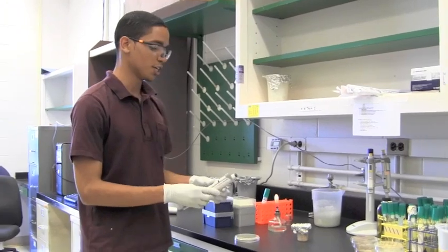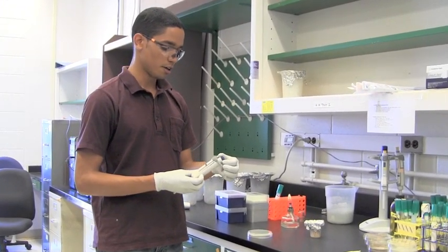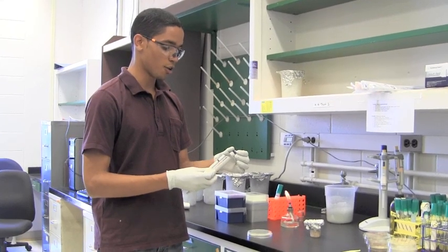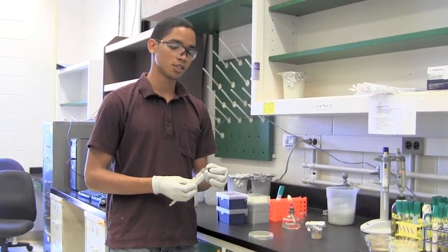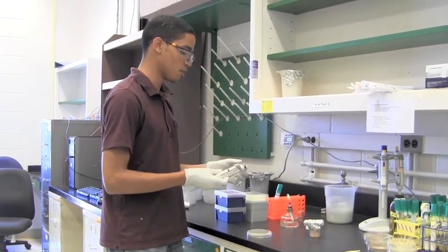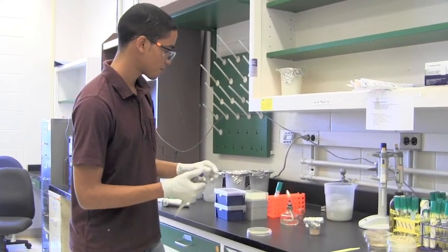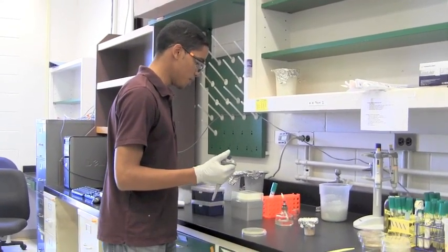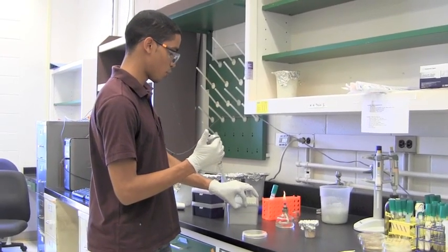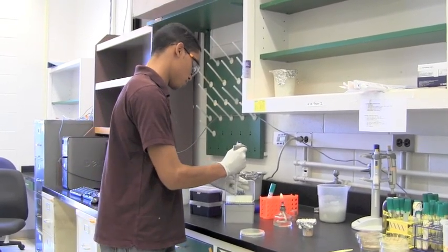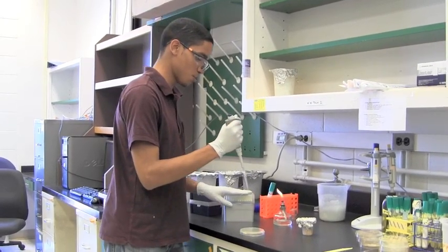So the first thing I'm going to do is set the volume on the micropipetter to the desired volume. We normally use anywhere between 100 microliters and 200 microliters depending on the inoculum itself. So I'm going to set it to 120. And carefully I will insert the appropriate micropipet tip, trying to keep the others as sterile as possible.